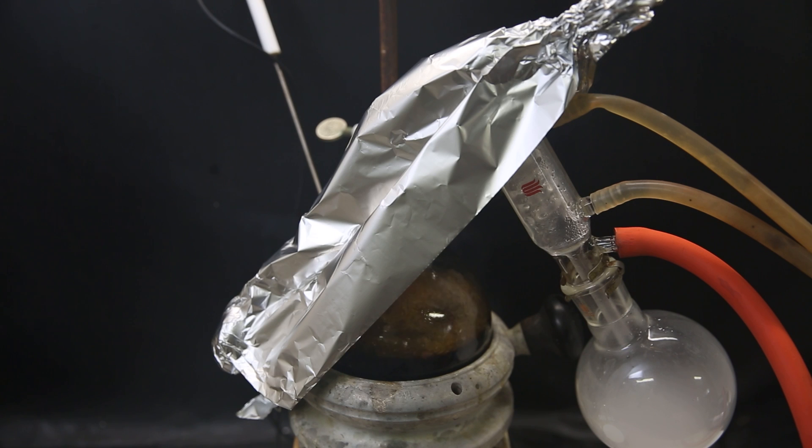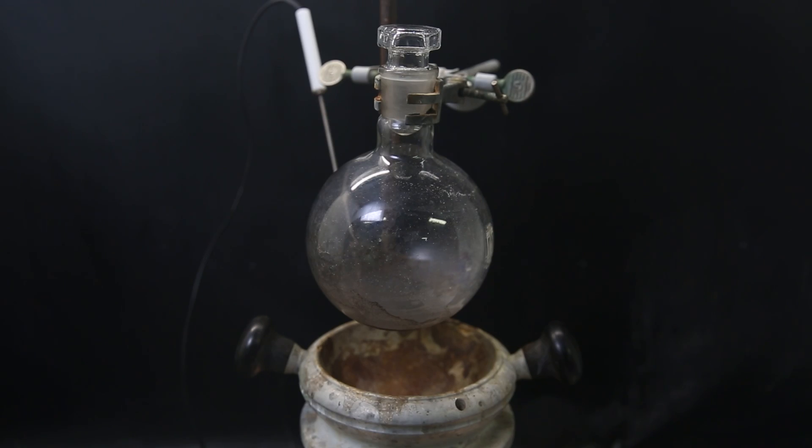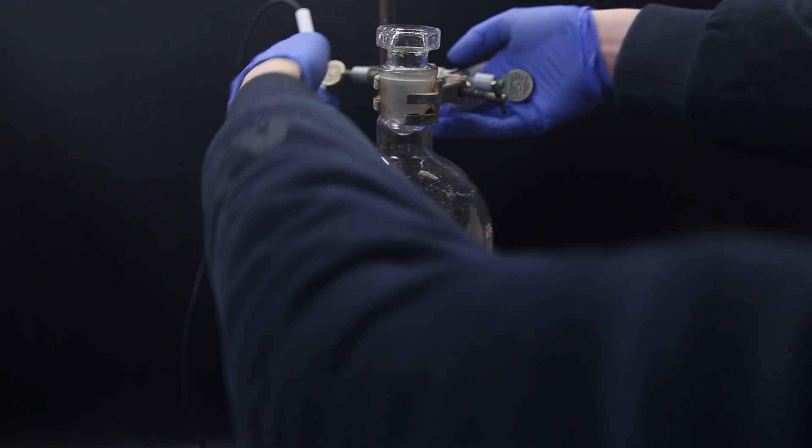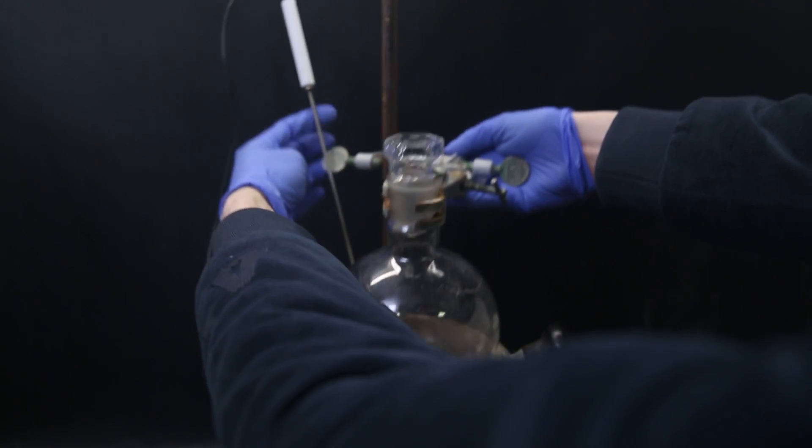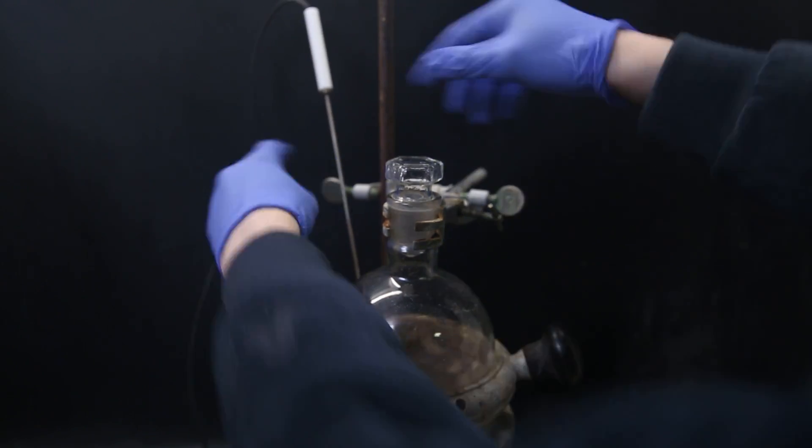And when the flask has become less full, I use a vacuum to distill it all over. When that's done, a solid black mass is left behind with a very aromatic and artificial smell, which reminds me of biphenyl that I made before. So that's a good sign.